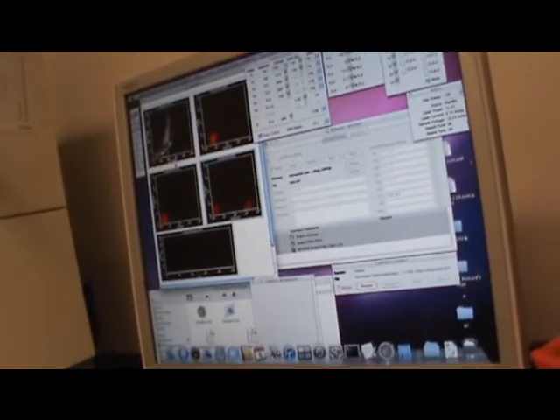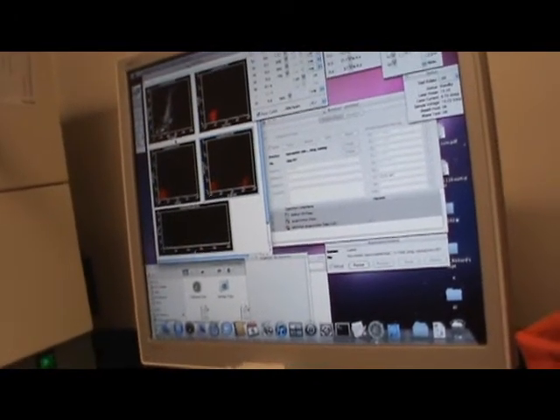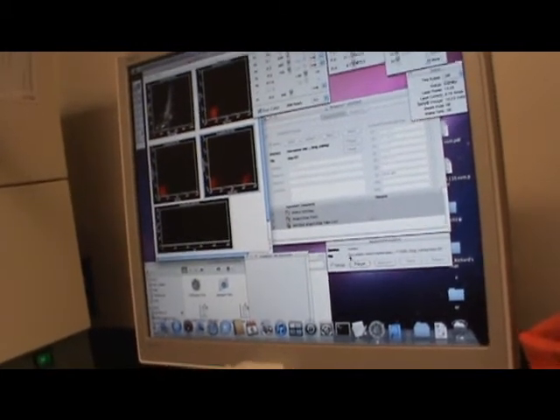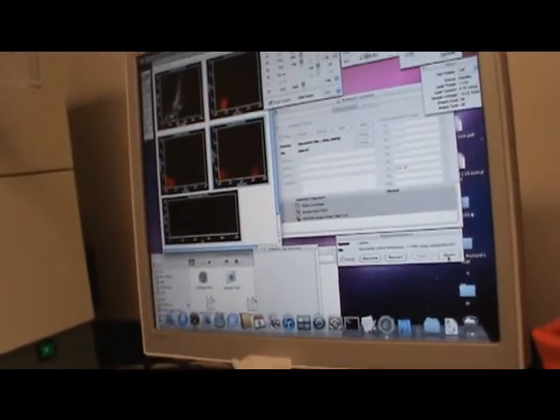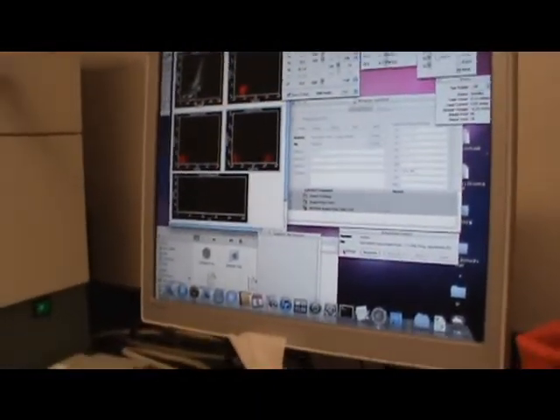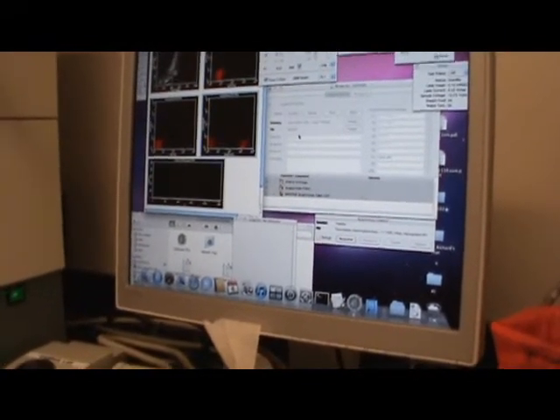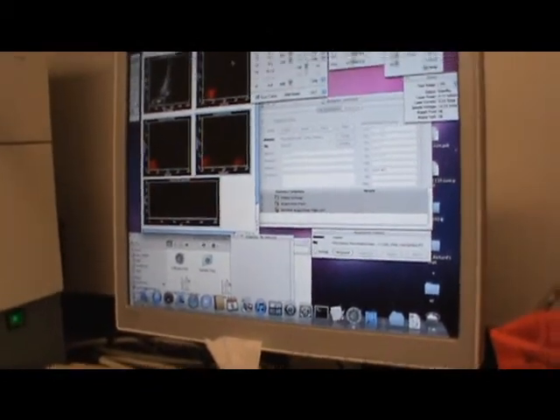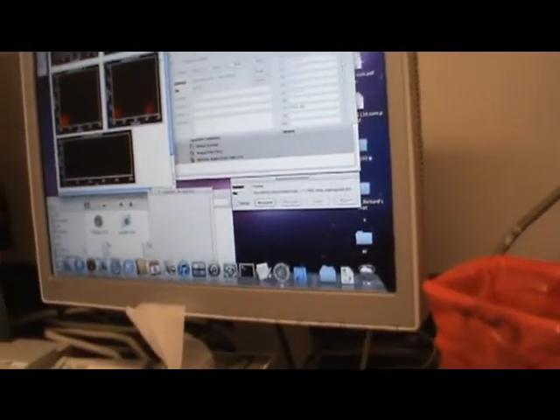Now, I think this system is perfect for me. I have optimized my instrument. Now I'm just gonna say pause, abort, set, uncheck, and then I'll save the data. Now I'm just gonna go ahead, and then you will see this number will change. Before that, I want to show you this. It's a monkey sample, sometimes you never know.